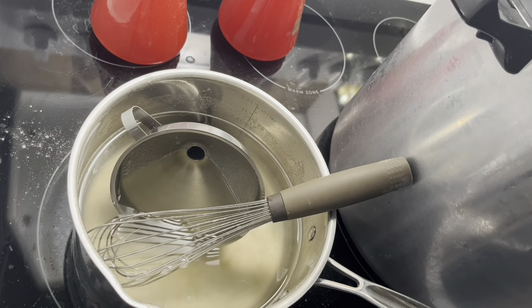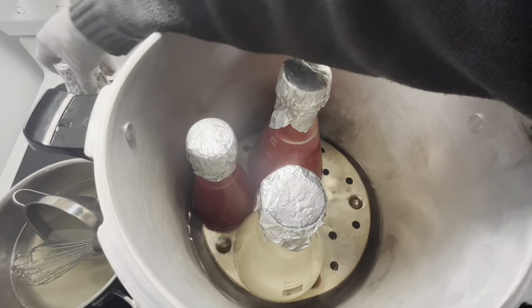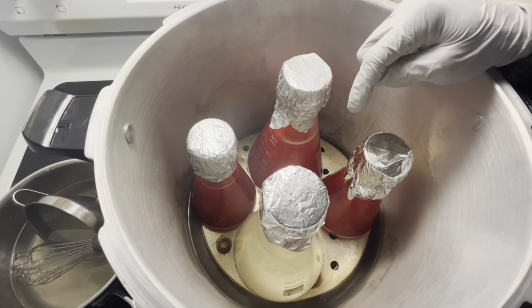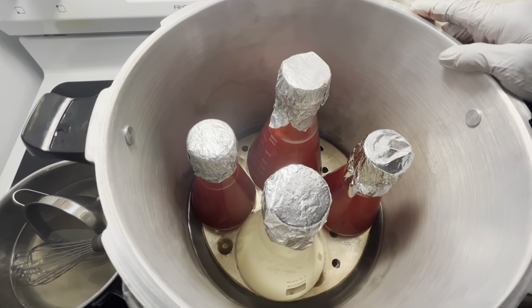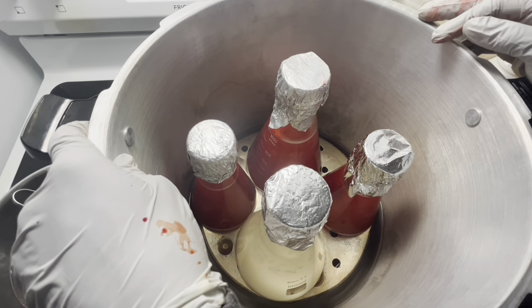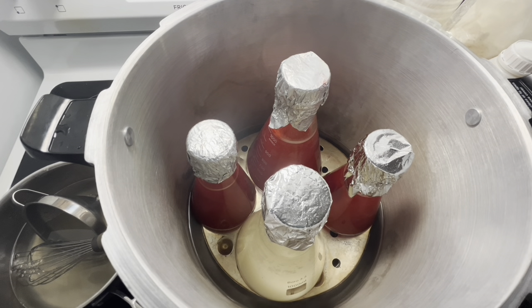So we're loading up the pressure cooker. I have a formal canning rack tray at the bottom — one of those round wire ones that hold mason jars — and then the plate that comes with the pressure cooker on top. I've been using this setup since day one. The pressure cooker says a minimum of 13 cups of water, but I've come to know that if I stick my finger in on top of the plate, the water should rest on my finger — that's how I gauge it.